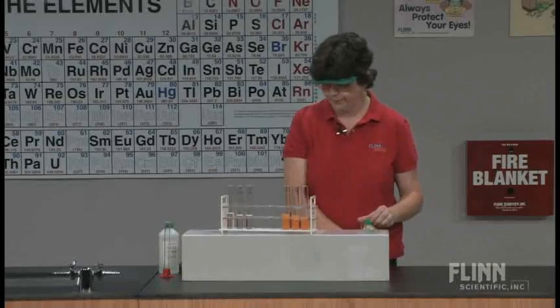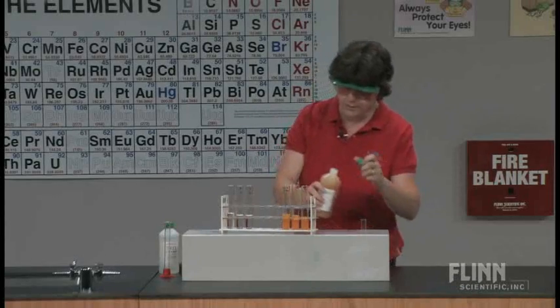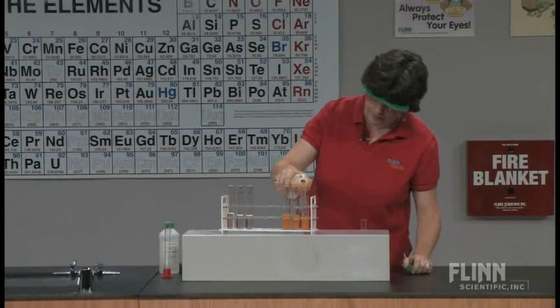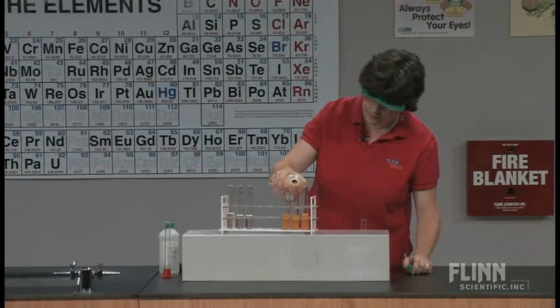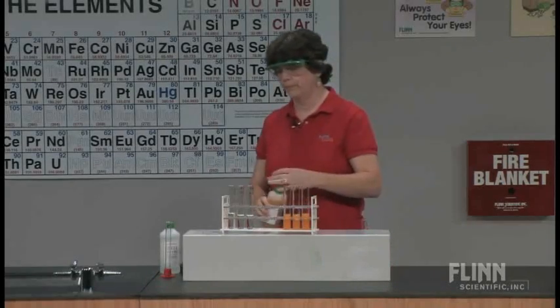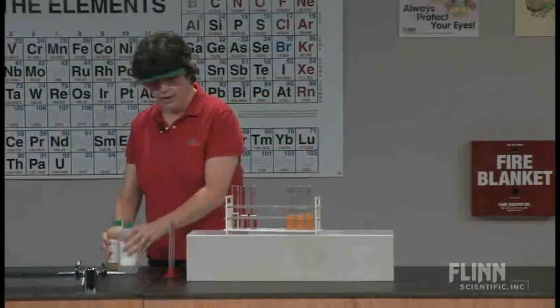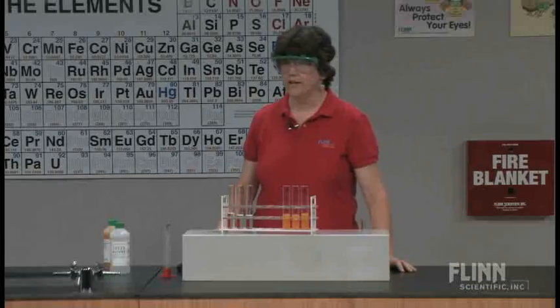No, those aren't even close. Okay. Alright, so we have our two different oxidation states of iron.